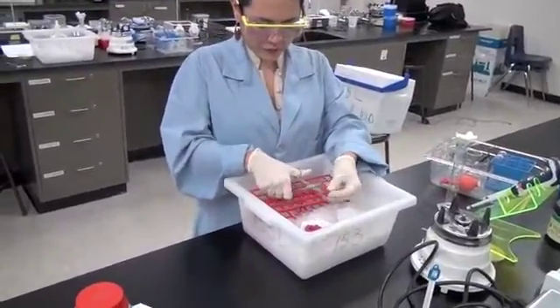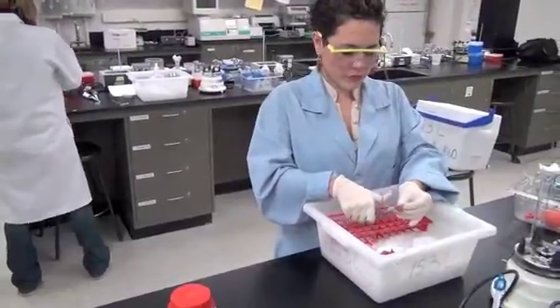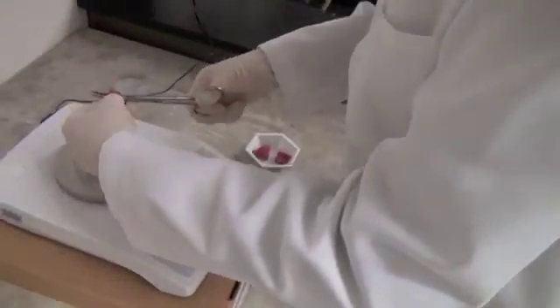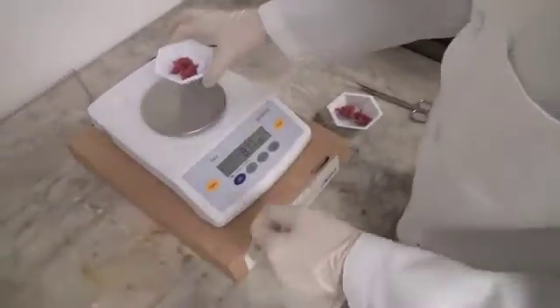With the smaller size, she'll be able to weigh 8 grams much more easily. Oh, it looks like she has some trouble weighing out her 8 grams. That's right, Mistress Entropy. She had to go back to her bench and get her scissors to cut those pieces of meat off. That's wasting precious time. Did you also notice that she had not been keeping her sample on ice whenever possible? She didn't even put it back on ice.